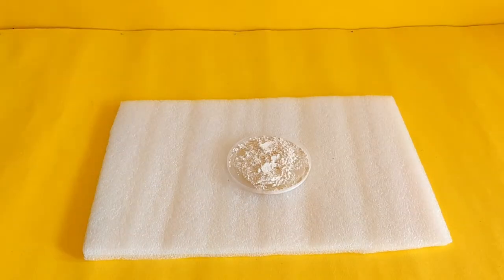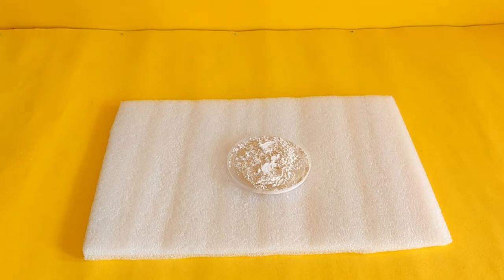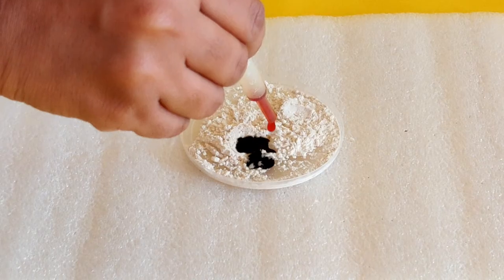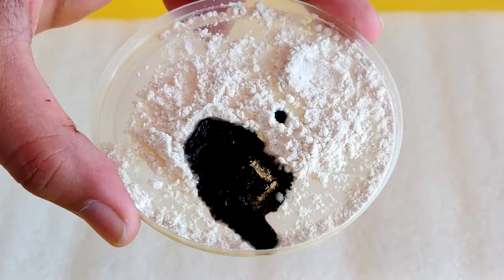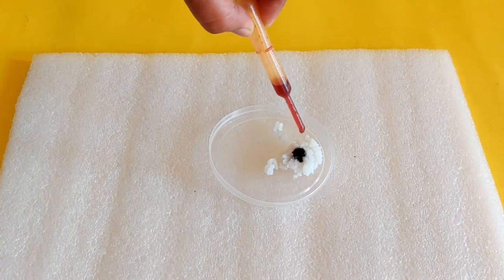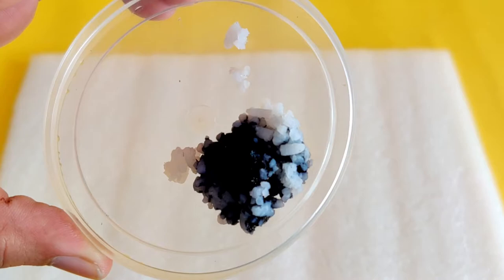Now, to conduct the test, we will take the samples in the lids and add a few drops of iodine to each of the samples. If the sample turns a deep blue or black when iodine is added to it, it indicates that the food sample contains starch.